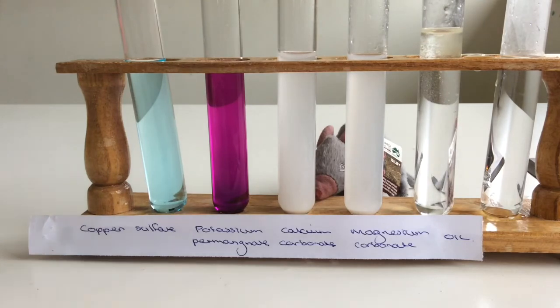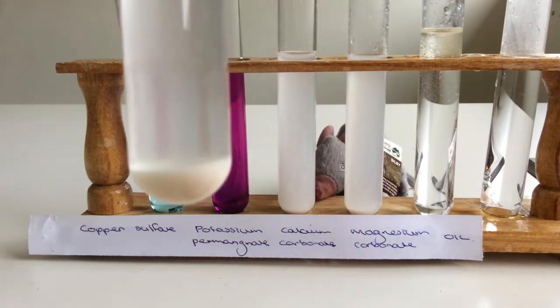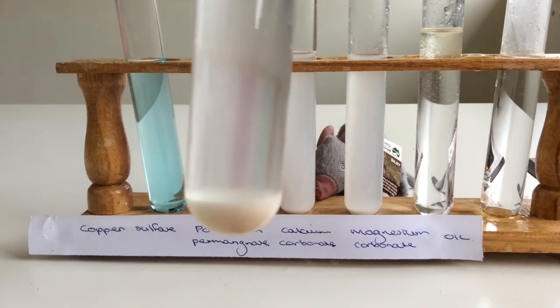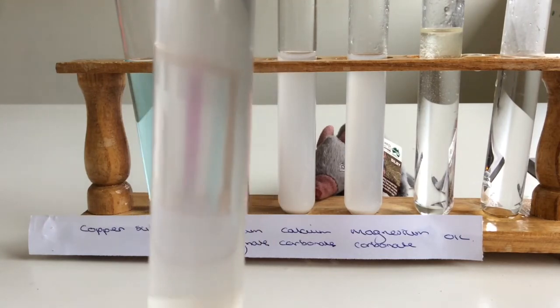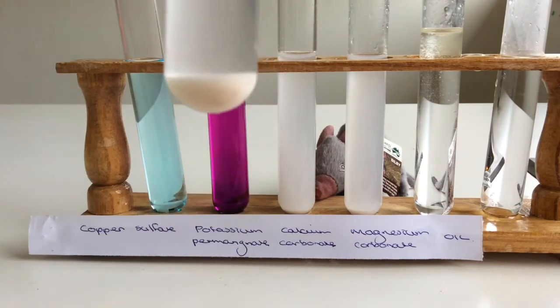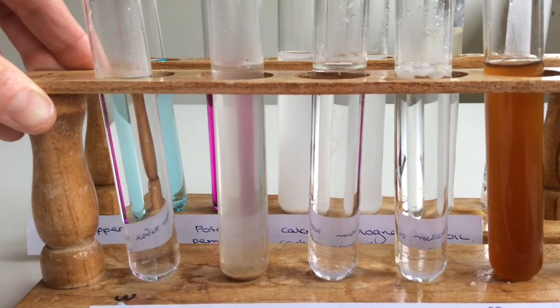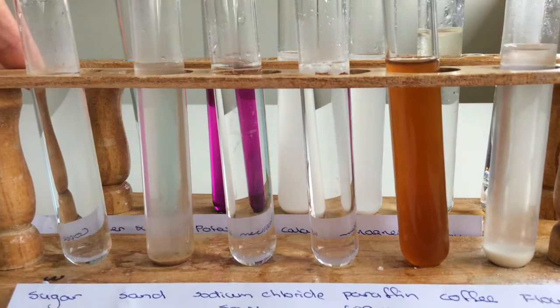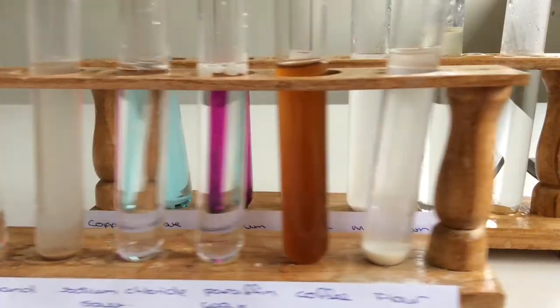I just want to show you the flour from the previous practical. It's been sitting there for a little while now. So you can see all the sediment down the bottom because I let it sit. And the particles have settled to the bottom of the test tube, which we call a sediment. So don't forget, you could probably do a lot of those at home as long as you get your parents' permission.